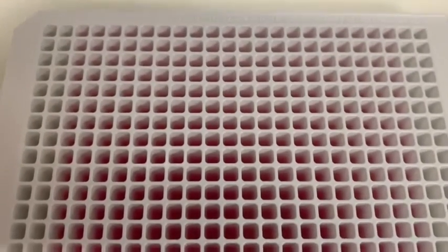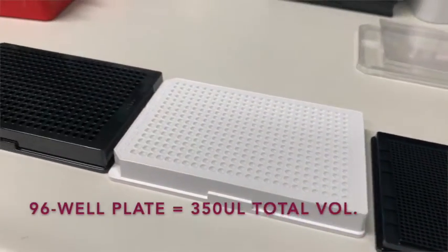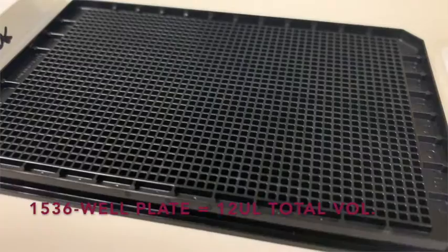You need an assay — an experimental setup that lets you check if compounds interact with your target. You need to miniaturize experiments from standard volumes in tubes down to the smallest volume that still allows robust detection of differences. The 384-well and 1536-well microtitre polystyrene plates allow you to conduct experiments at reduced volumes: 384-well plates allow up to 100 microliters and 1536-well plates allow up to 12 microliters of reagents in total.